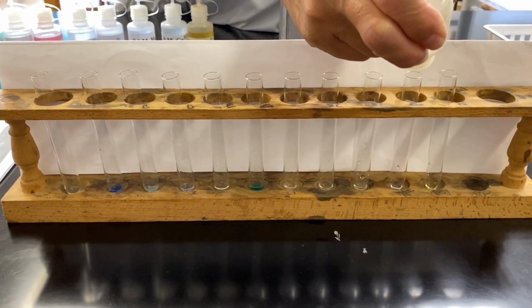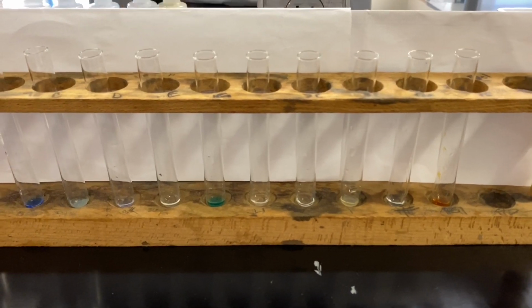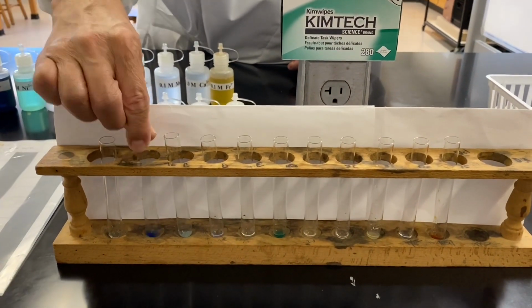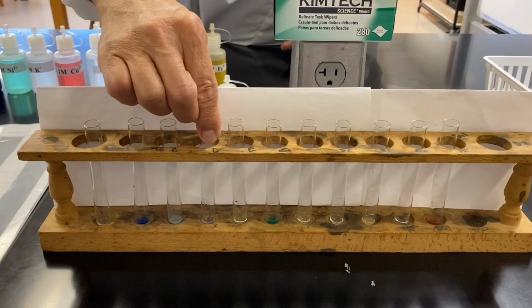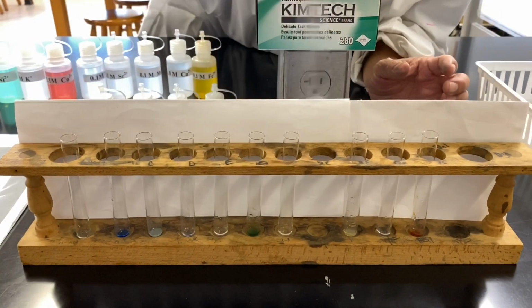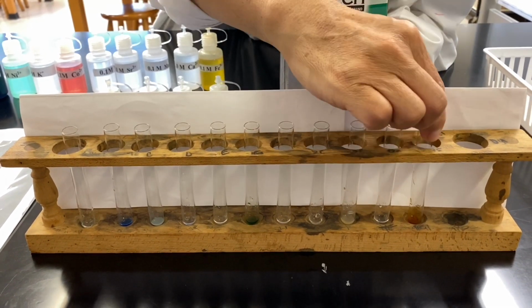Beautiful. Okay, very good. After all the additions, just give a gentle shake.